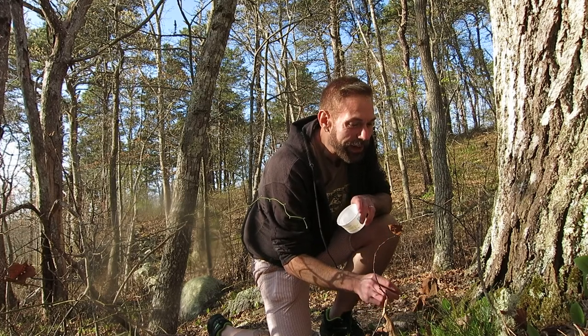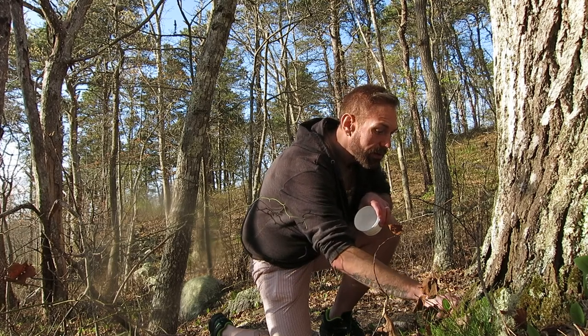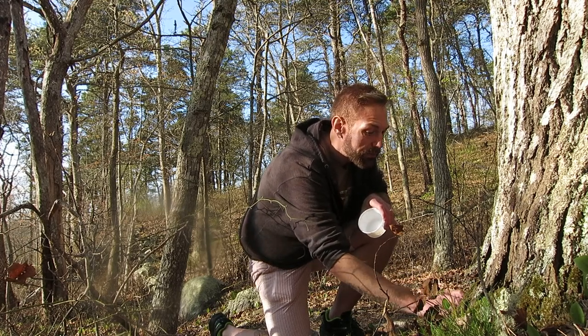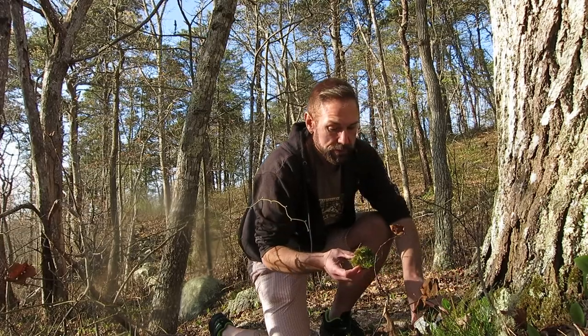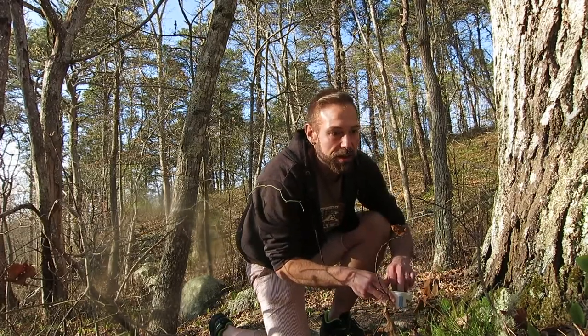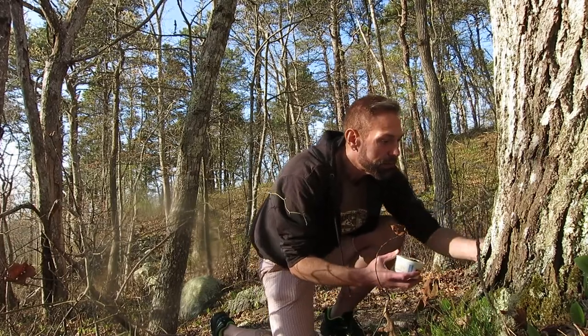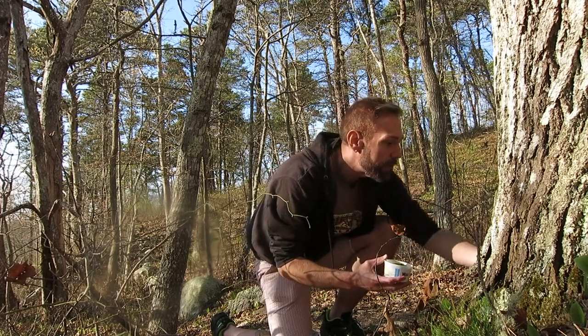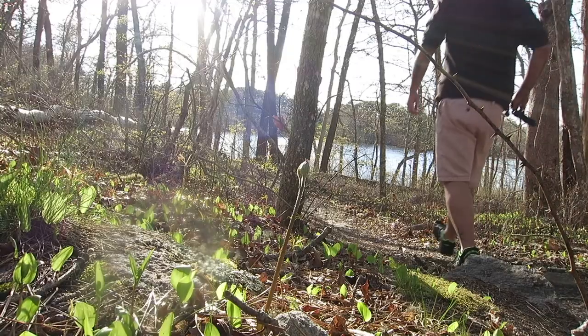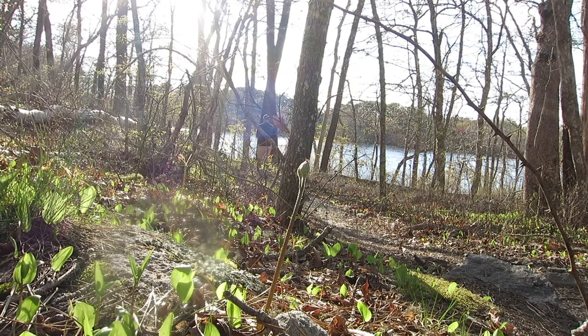It's pretty amazing. I'm gonna grab a couple types here, just kind of peeling it away. I'll pop that plug back in there, and I've got another type on this side of the tree. Not too much, and I'll see you back under the scope. That was quick.